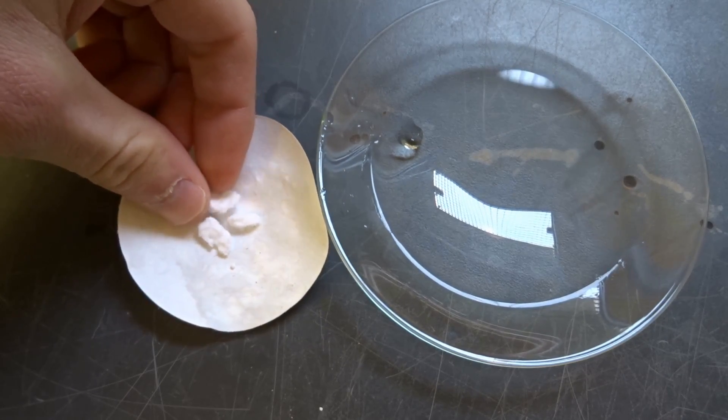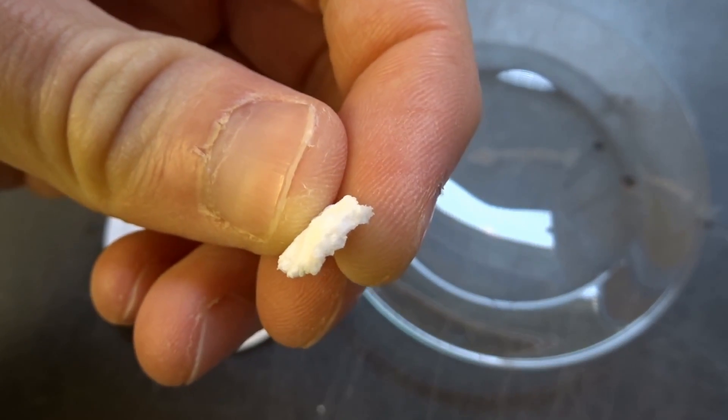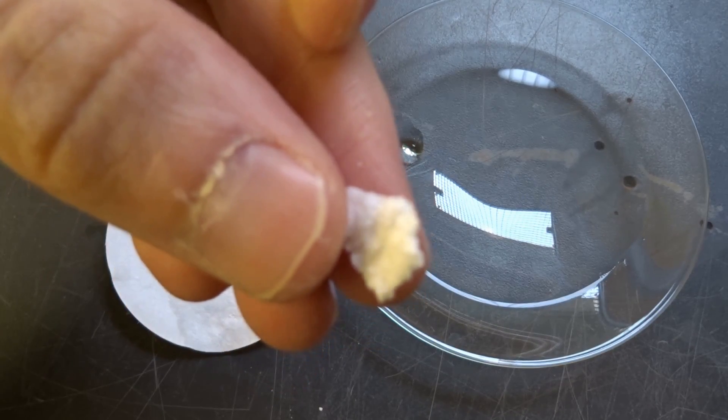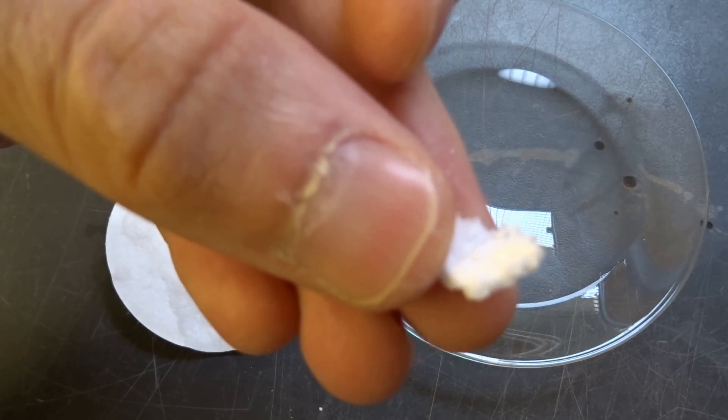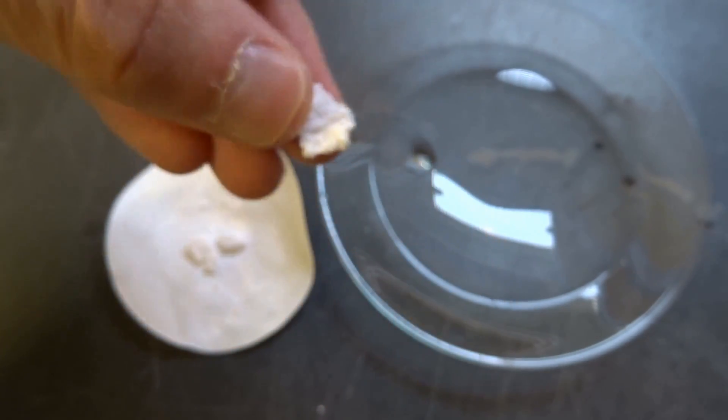Here you see one that has dried on air, and it was just taking out the water without any solvent exchange and dried in the air, and it shrinks to a hard clump of silicon dioxide. It's really hard, but still brittle.